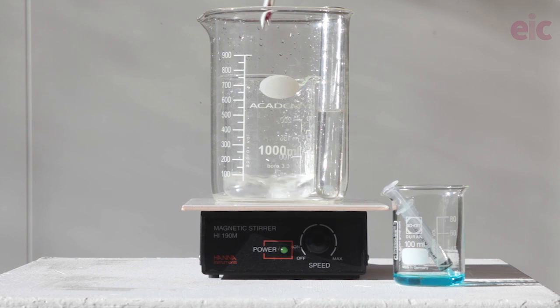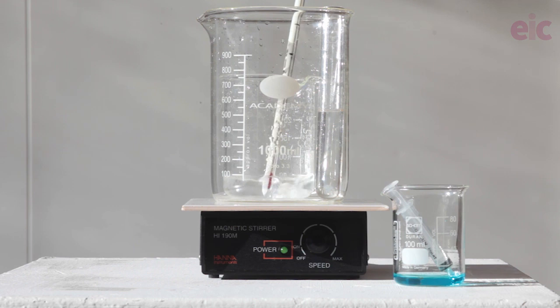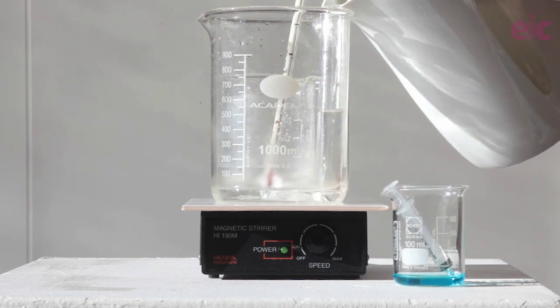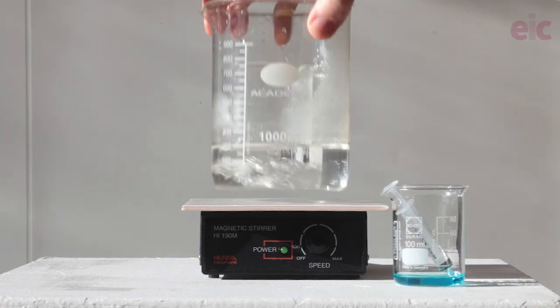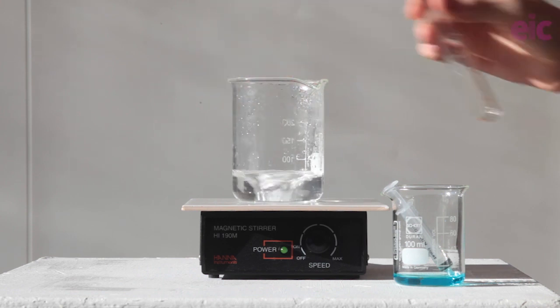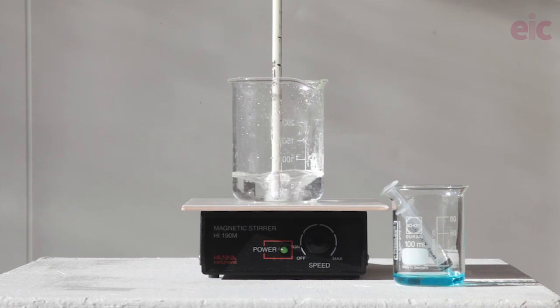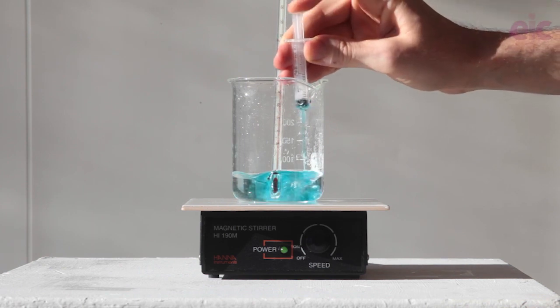Don't forget to wear eye protection. The reaction works best between 60 and 70 degrees Celsius, but the first change is quite exothermic, so aim to start between 50 and 60. Pop a thermometer into the tartrate solution, add hot water from a kettle to the one-litre beaker, and when the tartrate has reached 50°C, remove the one-litre beaker, placing the tartrate beaker directly on the white tile, which has also warmed a little. To initiate the reaction, add the 1 ml of copper sulfate solution and pay attention to the colour — we're about to heavily dilute the solution, but it's still a vibrant blue.